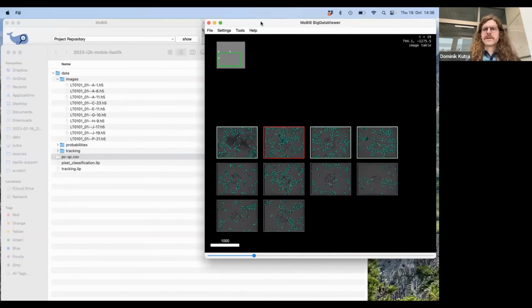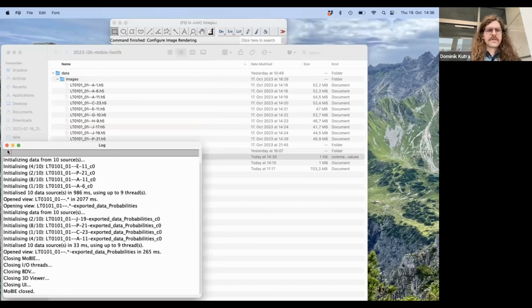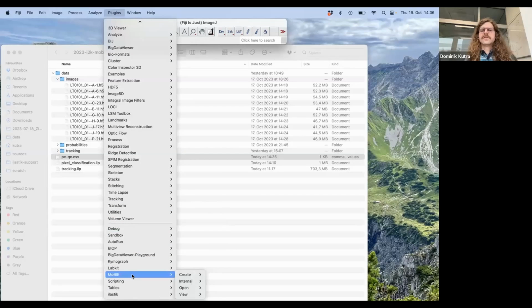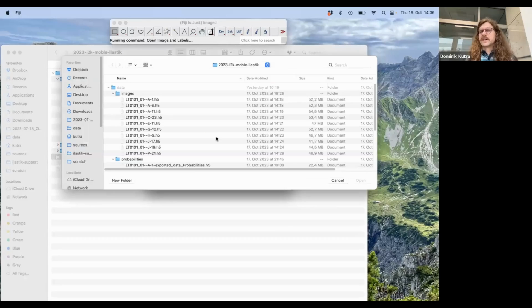Okay, and this way I will also quickly show. For this, I close MoBIE again, and to load these tracking results, we go to a different menu point, and this would be open image and labels. So what this allows you is to specify three things. First of all, I quickly delete everything that I have here. First of all, you have the image, and this should be the raw data.